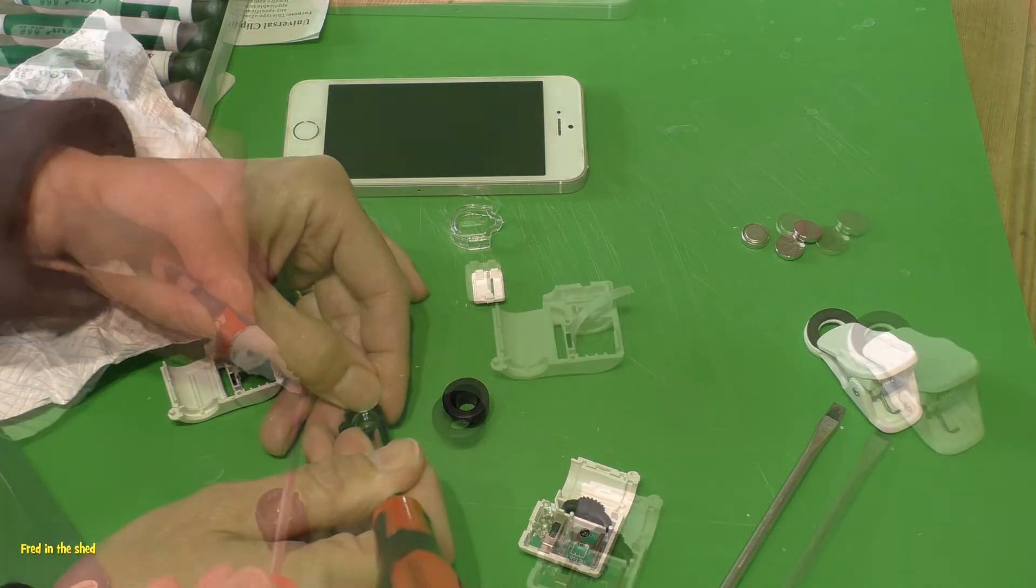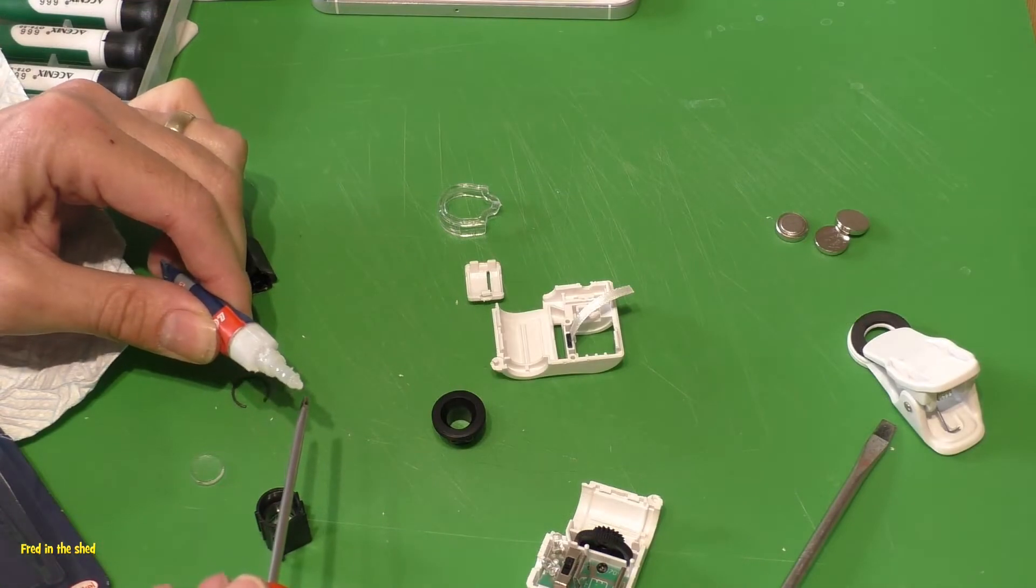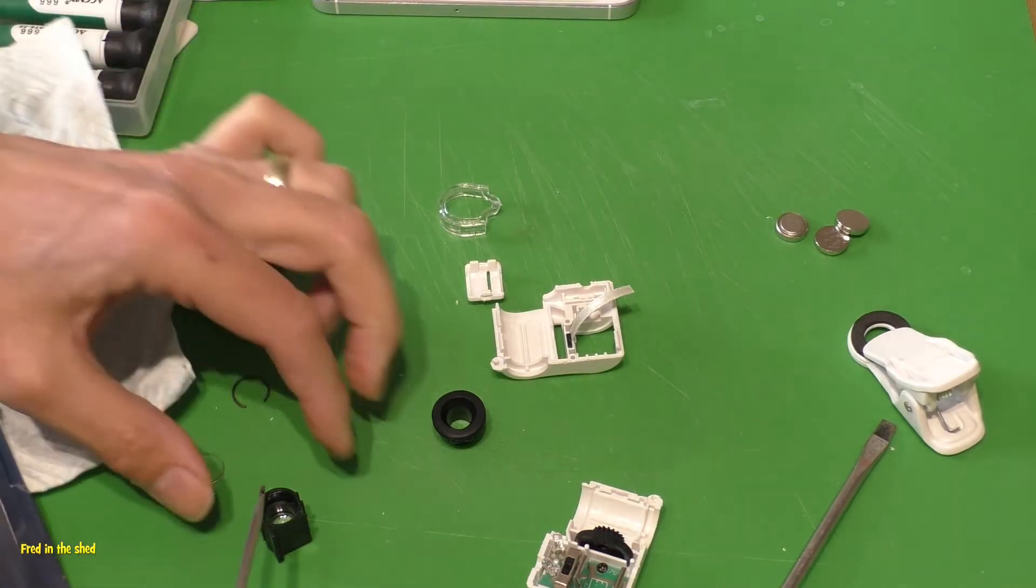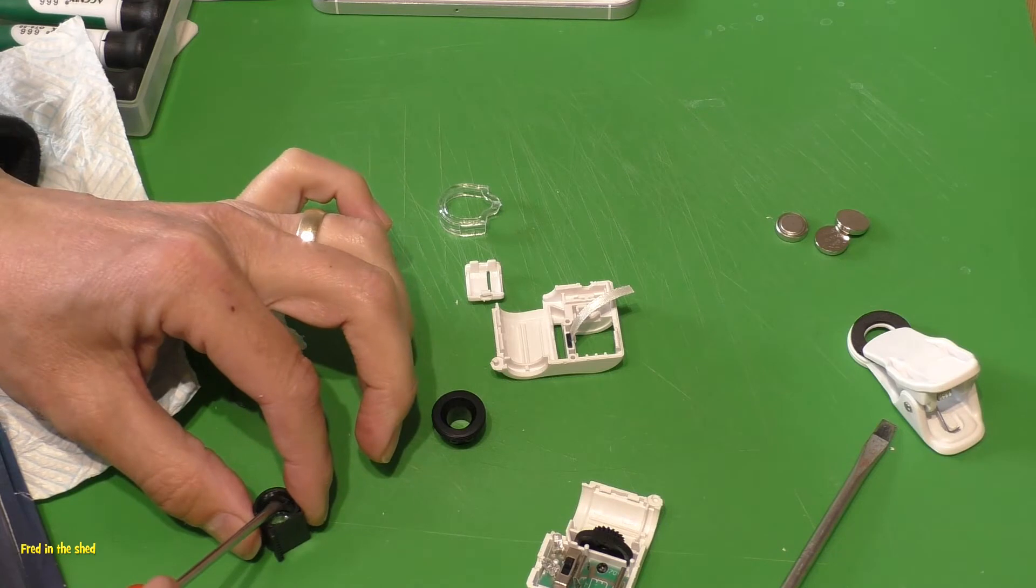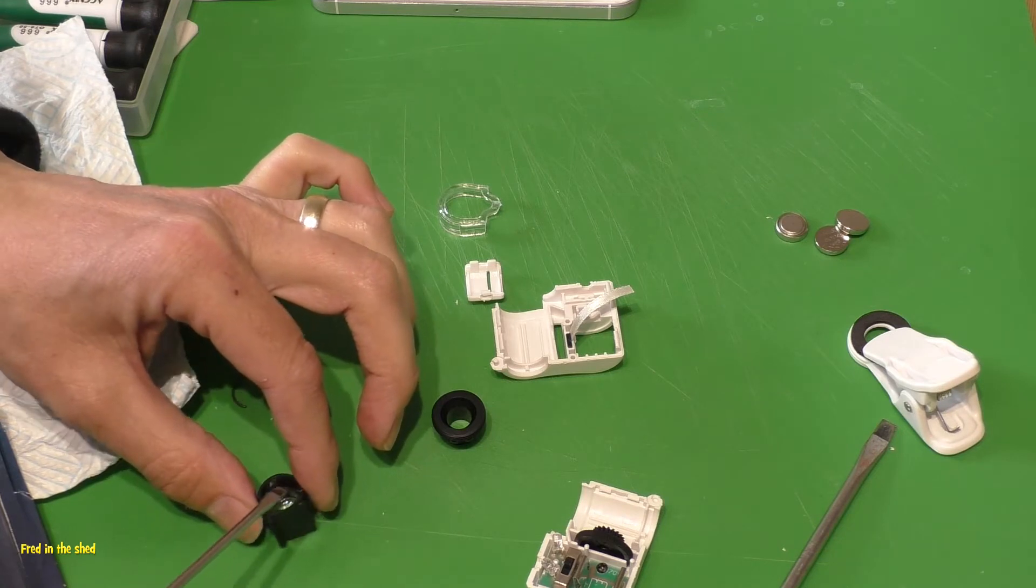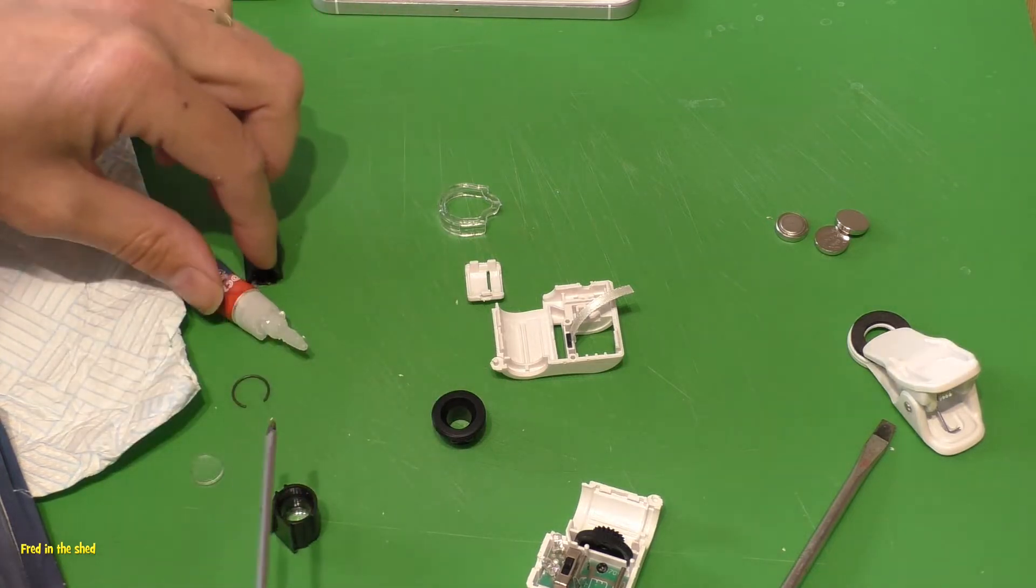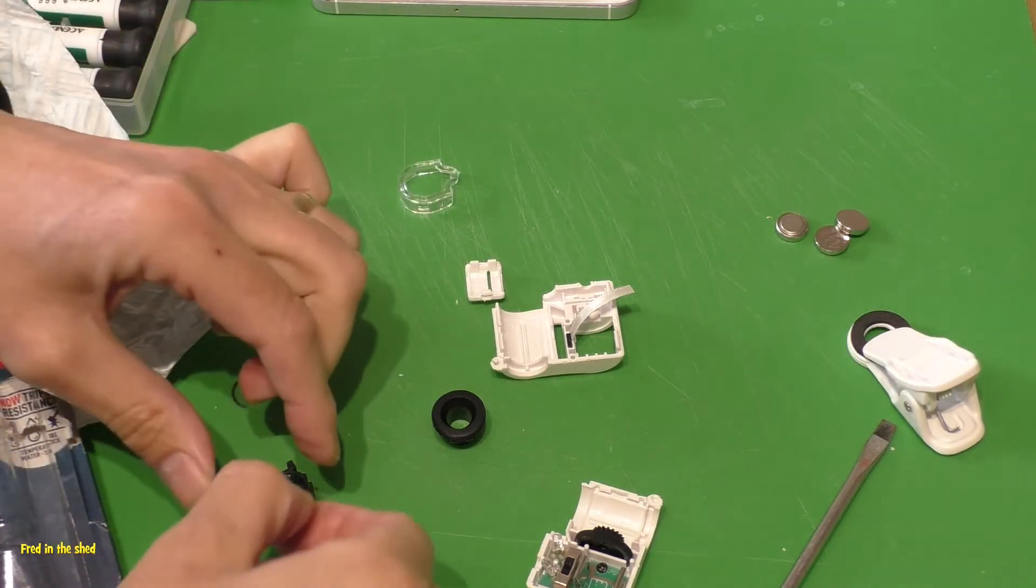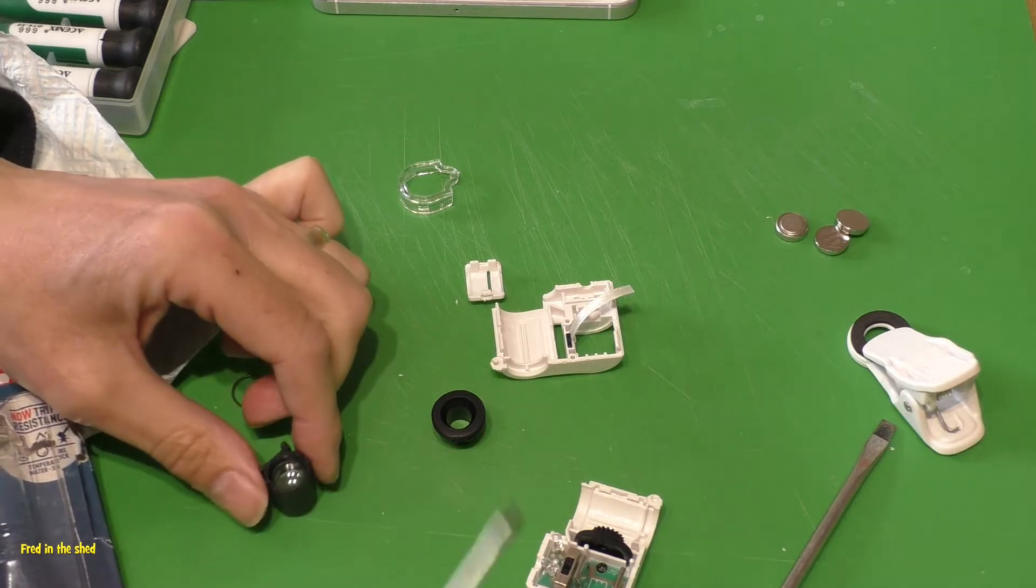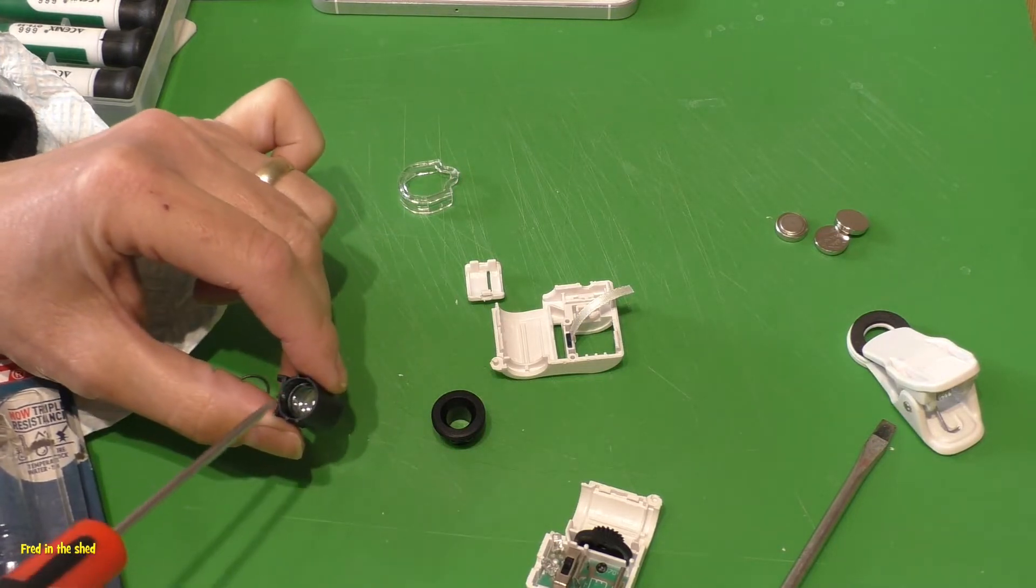I thought it's about time that I relied on some old super glue. I just put a very small amount of super glue around the ridge of the carrier part of the focusing tube, and then very carefully inserted the plastic - it's not glass - the plastic primary lens into the tube.